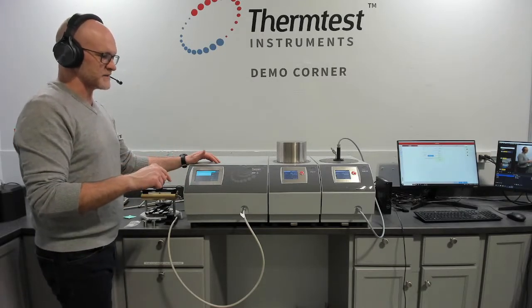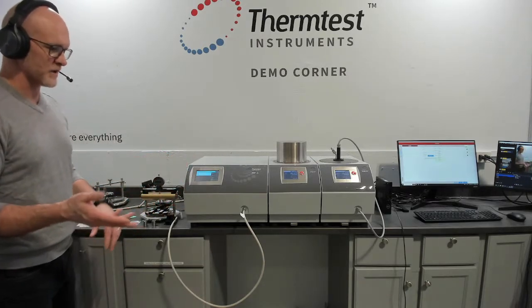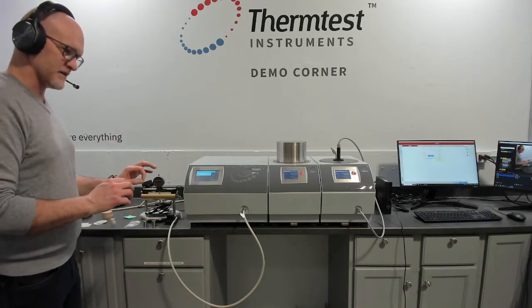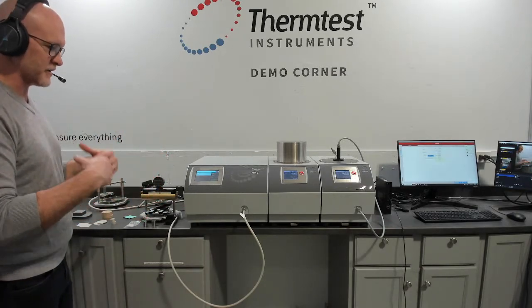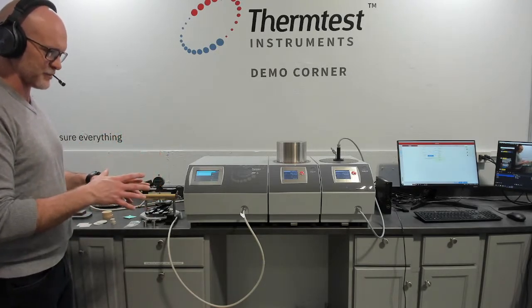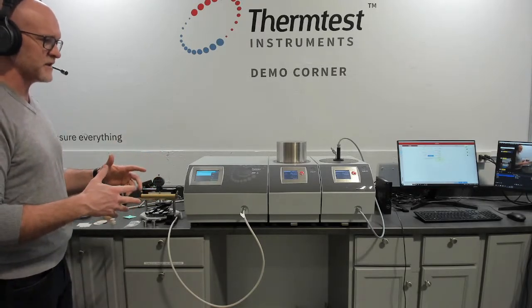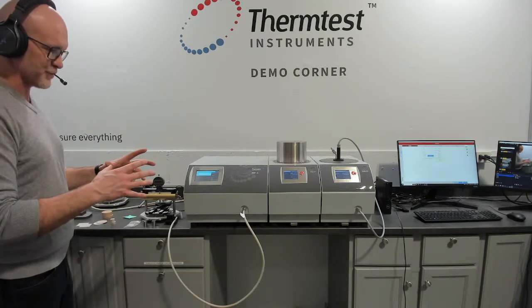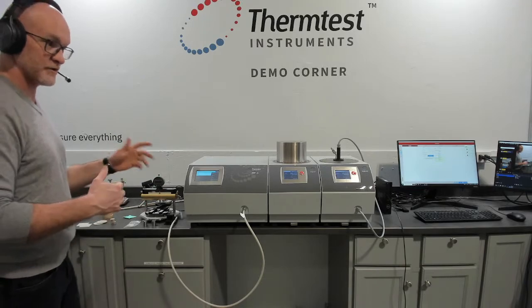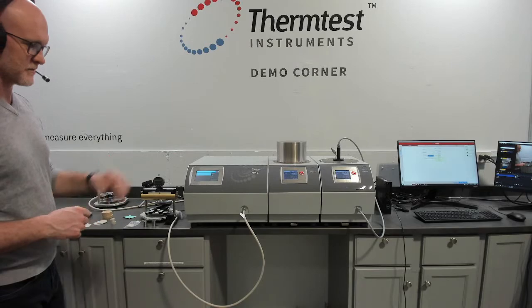So when you're looking at transient methods for measuring solids, like the transient plane source method, one of the key principles is the ability to vary time. One of the assumptions of a measurement is that the heat you're introducing into a semi-infinite body is staying within the dimensions of the sample. That is physics. That is one of the assumptions of the method. If you're hitting boundaries of your sample, you are going to get effects of reflections and disturbing your raw data, and your data will be wrong. You'll be breaking one of the assumptions. So test time is really critical.